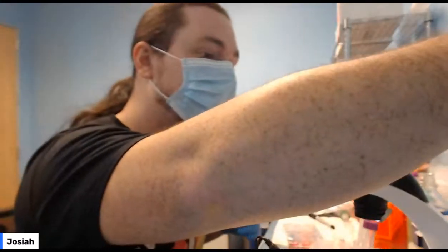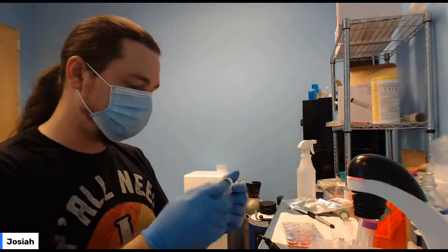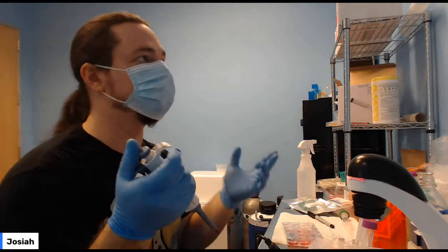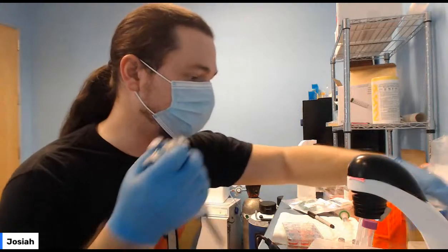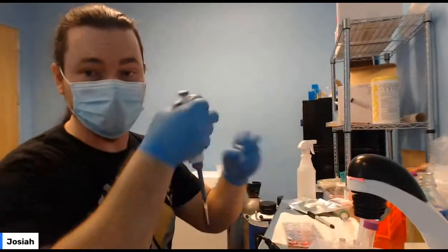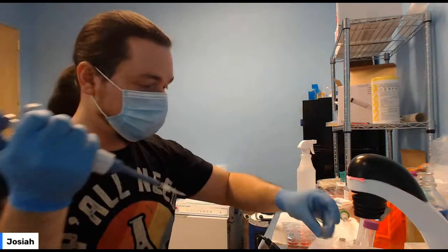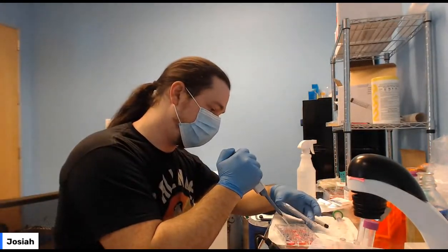We used about 70 or so. It's like 50 plus 10 plus 3, so make sure you have plenty of room to pick up the whole reaction. And then you're just going to add this to the well. Again, you're picking up the ones that you've changed. Pick up your plus, add it to a plus. Doesn't really matter which one.